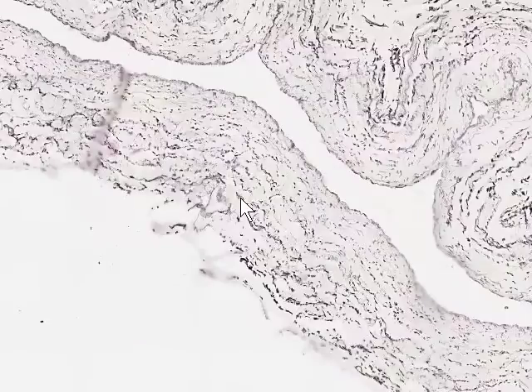Here's the accompanying vein stained with the same elastic stain. Again, we have the endothelium lining the luminal surface here. The first thing you'll notice is that there isn't any dense, dark, intense staining internal elastic lamina, and neither do the tunica intima or endothelium stain intensely. And the next thing that you'll notice is that the material which does stain in the tunica media doesn't appear as long fibers really, but rather as small punctate dots.